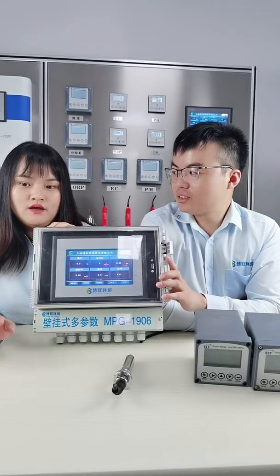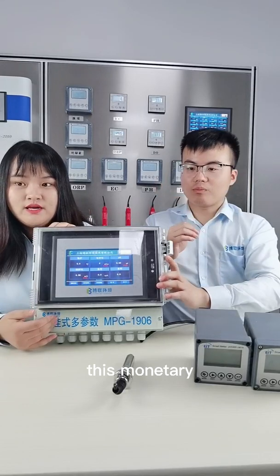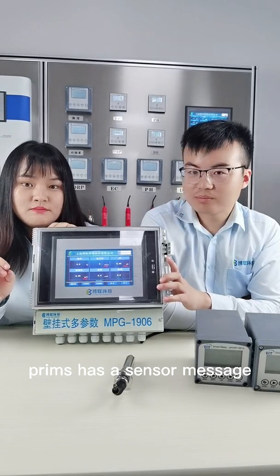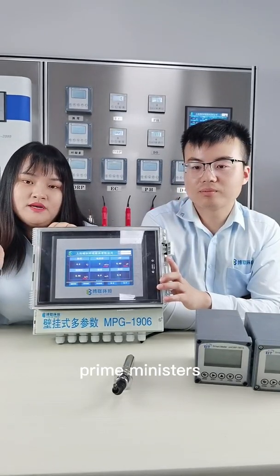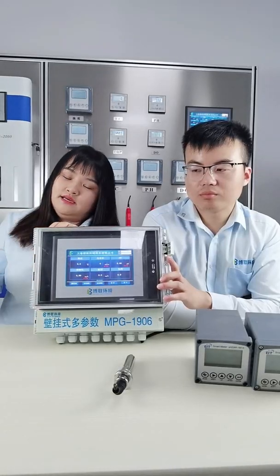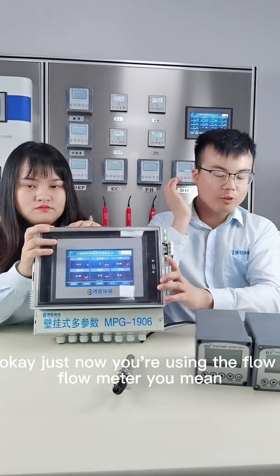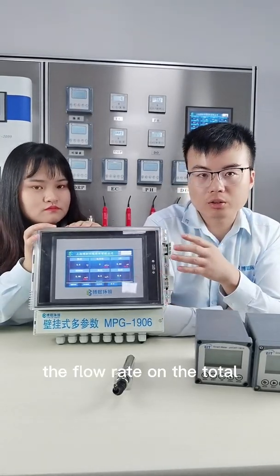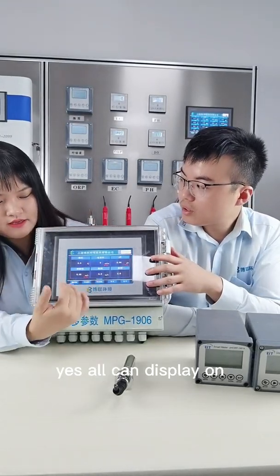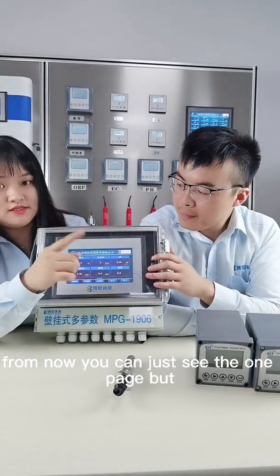It is no problem. We can do almost all parameters for this monitoring. The only condition is that the parameter has a sensor method. For example, some parameters don't have a sensor method, only a chemical method, so we cannot integrate those parameters into this controller. Okay, just now you mentioned the flow meter. You mean the flow rate or the total flow can be displayed on the screen together, right? Yes, all can display on this screen.